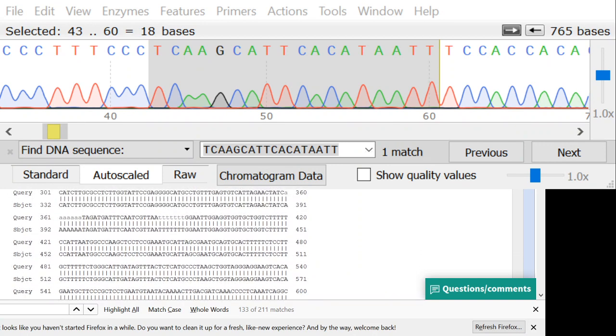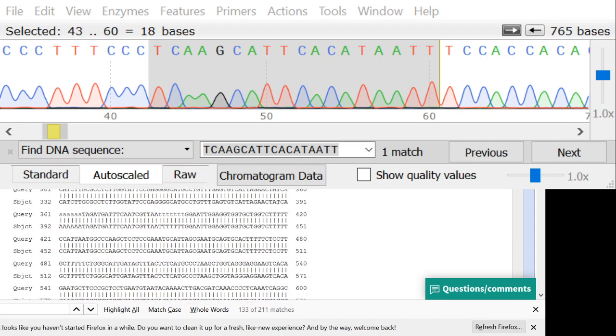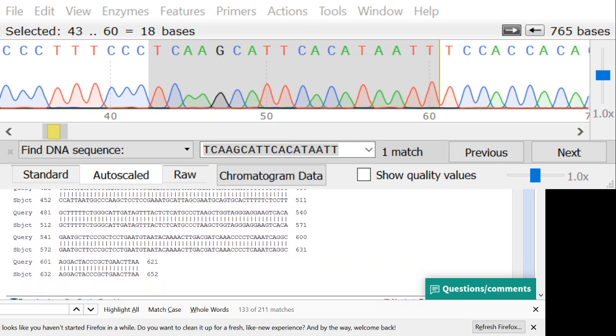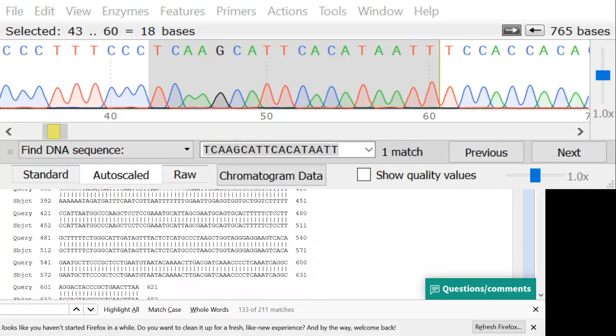So in this case, knowing that 620 of these bases match, we know that we got a good quality read. This is the ITS1 right in here, and then in the middle there's a 5.8S gene, and then at the end there's ITS2. The 5.8S gene in the middle is a very conserved gene, so I know that if I see differences in 5.8S, that's because there's a problem with the sequence. There shouldn't be any differences in the 5.8S. Since there are no differences here, I know we got good reads and we're actually getting good data.